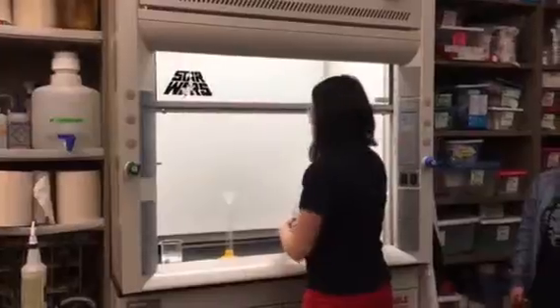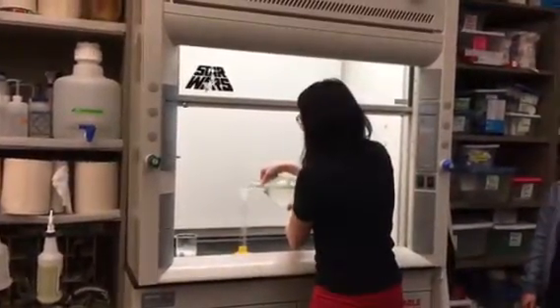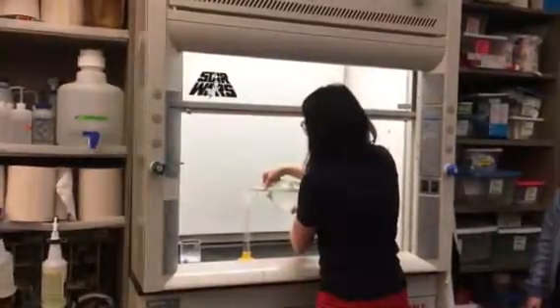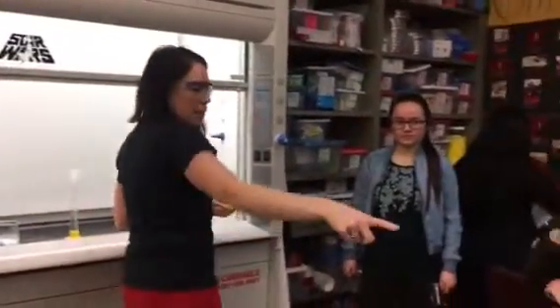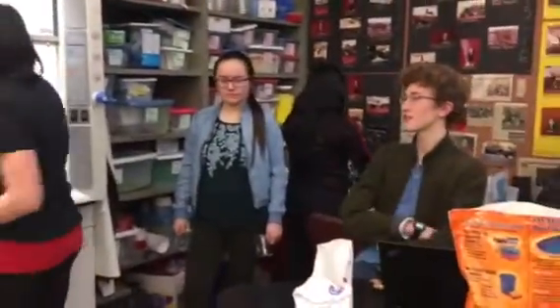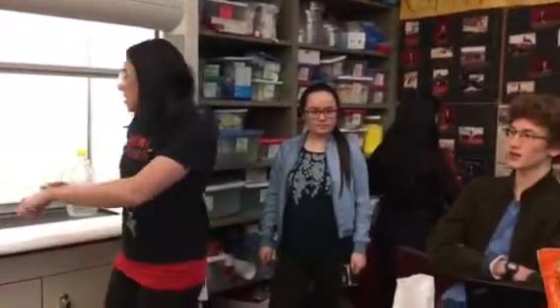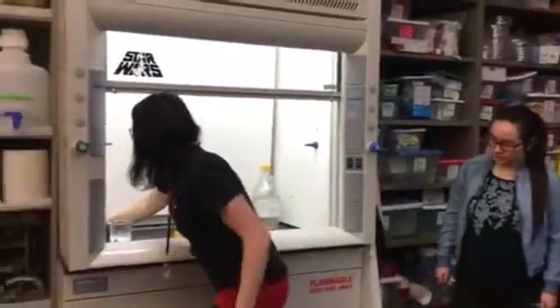I'm carefully measuring out about 60 milliliters. Does anybody know why I have baking soda out? It's really close to me doing this experiment — I have a big bag. It's a base. And what will happen if I spill some of this acid somewhere? Put baking soda on the spill, wherever, and it will neutralize it and turn it into water.